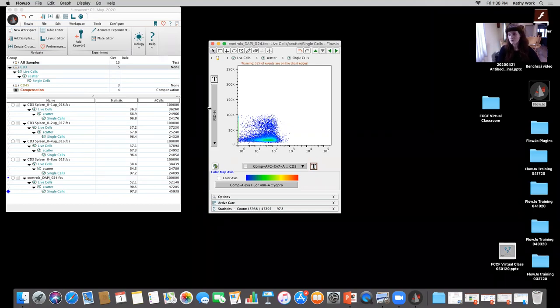But then it's important to go back to the scatter, and sometimes we do it through backgating to clean up the scatter, so that not only in terms of statistics, but also in terms of identifying populations, it becomes much easier. Yes, absolutely. And if we have time towards the end, I can reference back also to a flow post that we have about vital dyes and why they can become very important. For example, in this experiment, the scatter could be overlaid. You can have large debris and small cells, and it's very hard or impossible to pull out just by scatter gating.